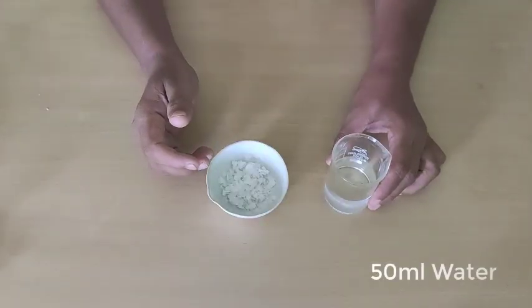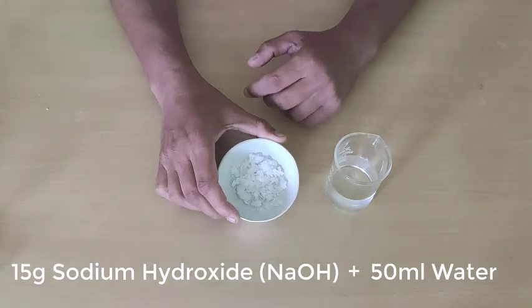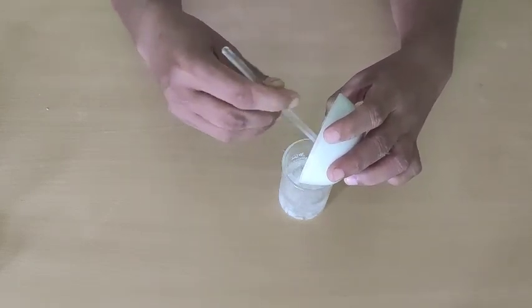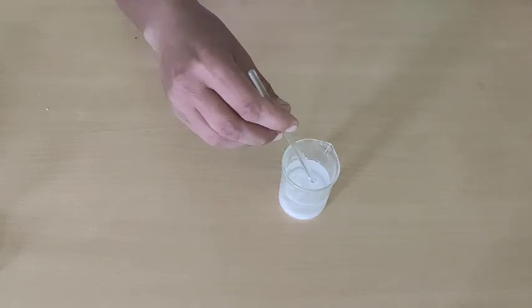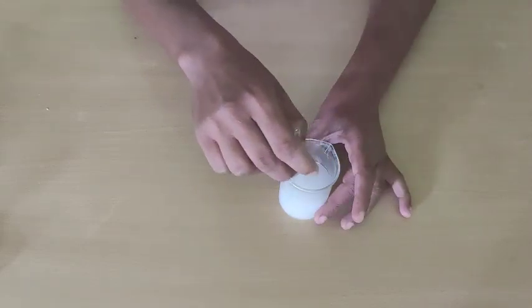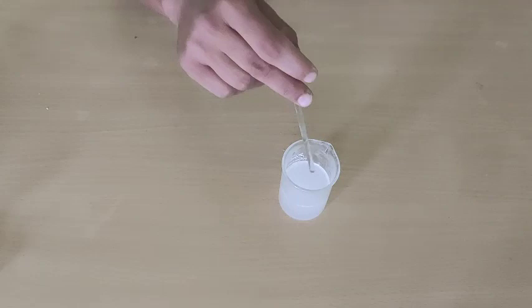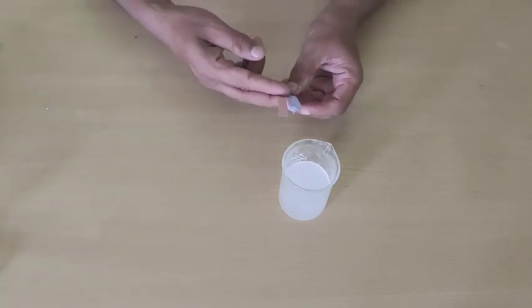For preparation of soap, we have taken 50 ml water in this beaker. In this bowl there is sodium hydroxide — these are sodium hydroxide flakes. I have taken 15 grams of sodium hydroxide and we will prepare a solution of sodium hydroxide. We stir and prepare the solution. It is an exothermic reaction and a milky solution is formed. Now the 15 gram sodium hydroxide solution is ready.